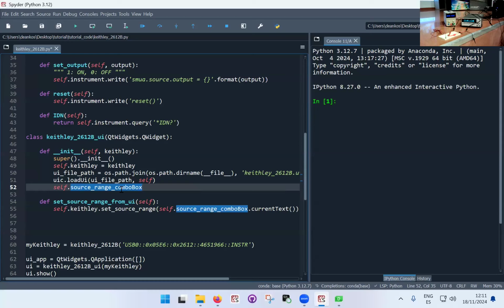So self dot source range combo box, and now here I need to decide on an event that is going to trigger the function below. In the Qt language, these are called signals and slots. We're not going to go into that syntax right now, but anyway, I need to tell when this function is supposed to happen, when the Keithley is supposed to be updated with the value from the box, okay? And this is something I have to decide myself as a user when I design the user interface.